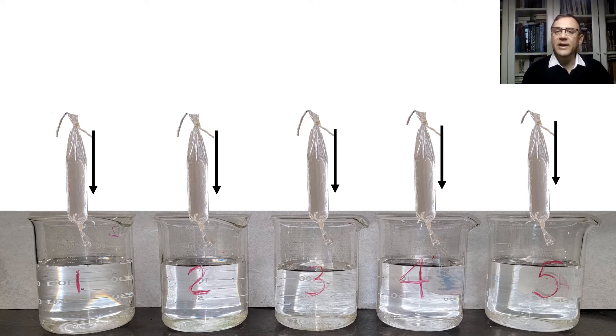By immersing dialysis bags in these beakers, we will simulate different osmotic environments and observe how water moves across the membrane in response to varying solute concentrations. This experiment will help us understand the behavior of cells in different osmotic conditions, which is essential for comprehending various biological and physiological processes.